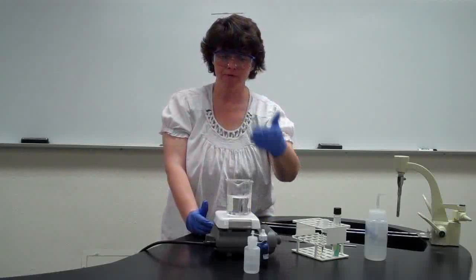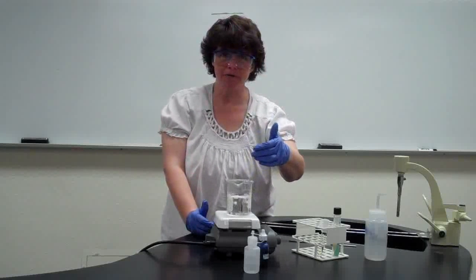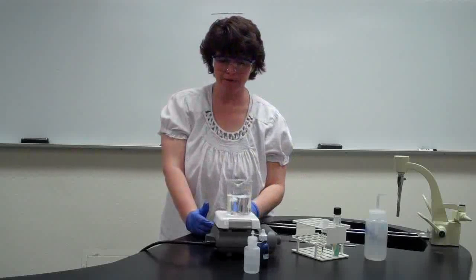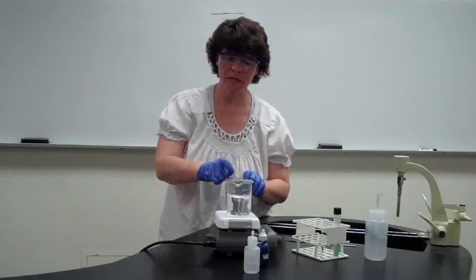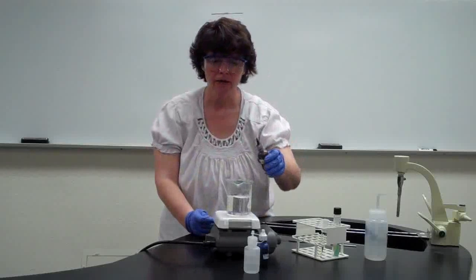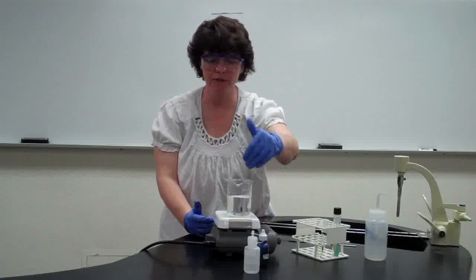While this is steaming for 5 minutes, you want to keep an eye on it, because if it dries out, it's not going to stain properly. So as it's going along steaming for 5 minutes, keep an eye. If it looks like it's drying, add some more stain. Okay? Try not to let it run over too much. Like I said, just enough to cover it, but not that the water's turning color.